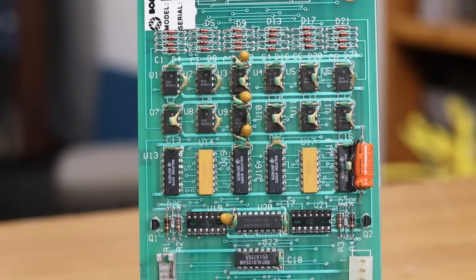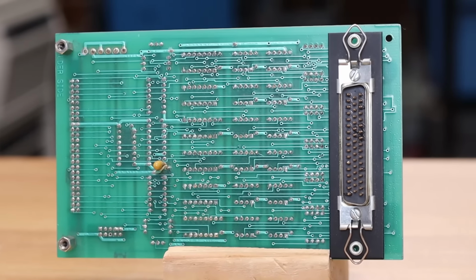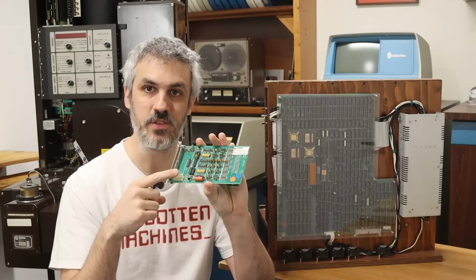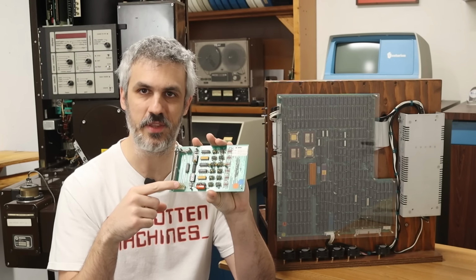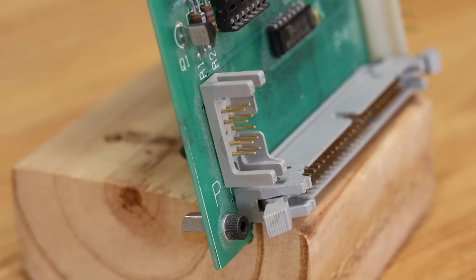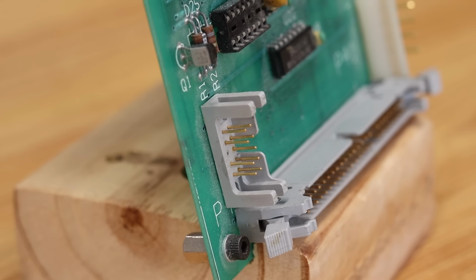This is an opto-isolator board that allows us to connect the high-performance vector processor to the DA-3. We do need to supply separate power to this. I think it's only going to take 5 volts, but I need to double check the documentation on that. And we have an extra little connector up here to go to a serial port. And then I got to find someplace to mount this thing.